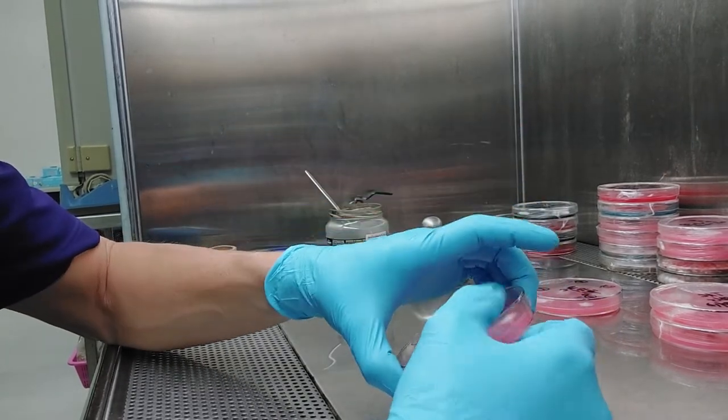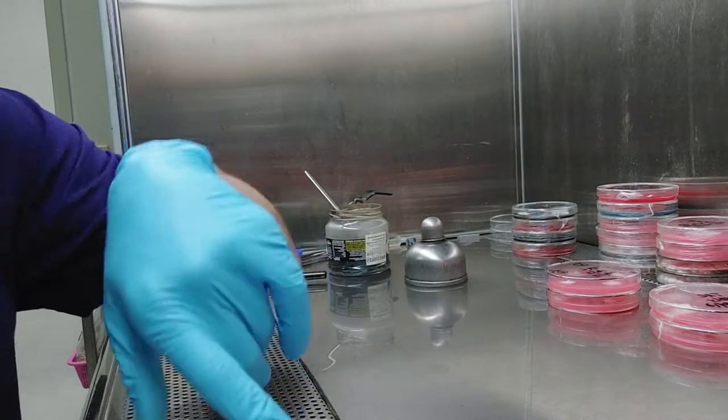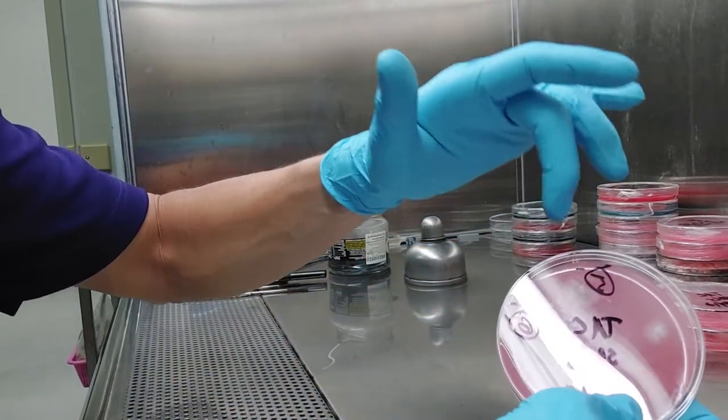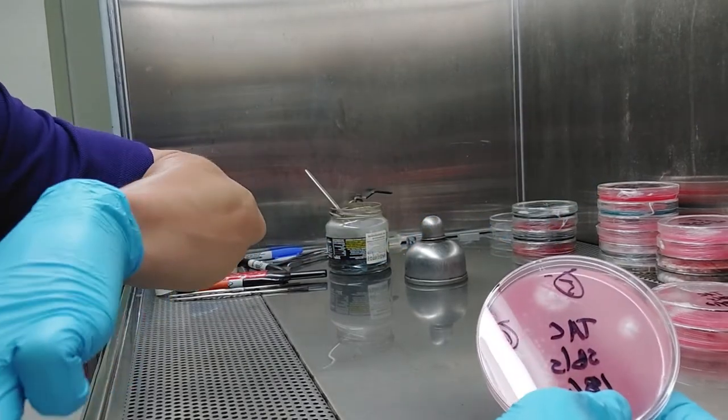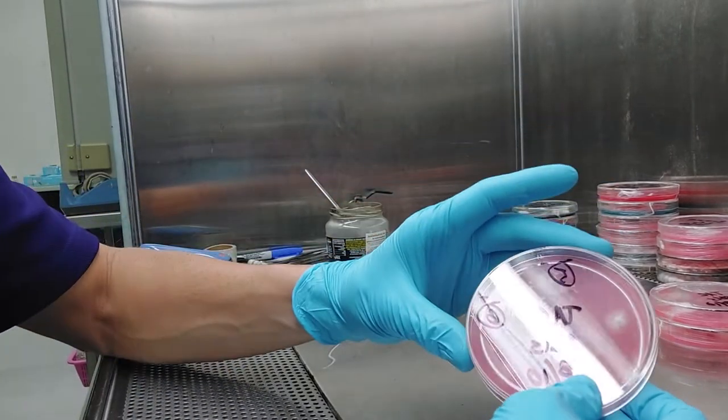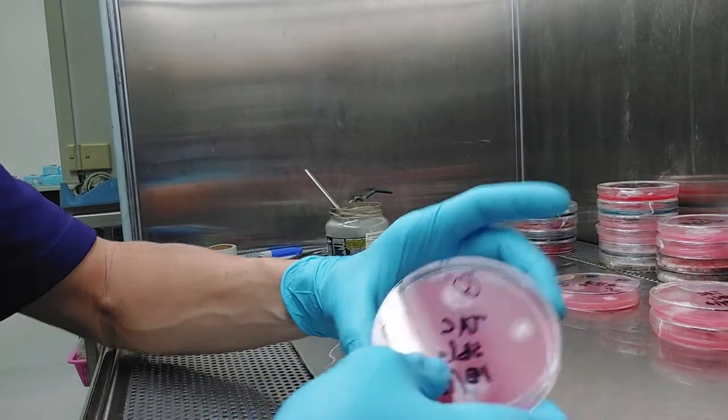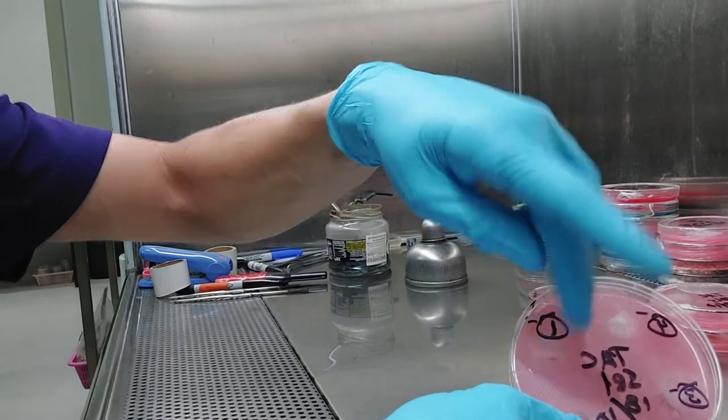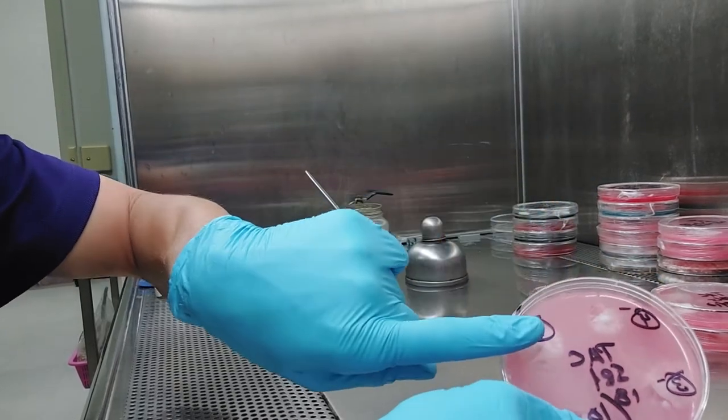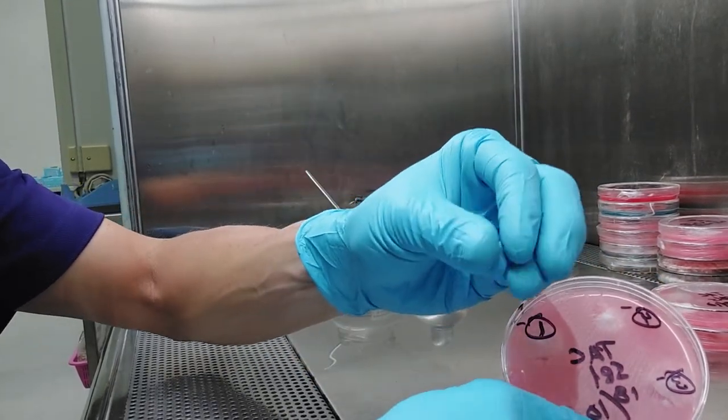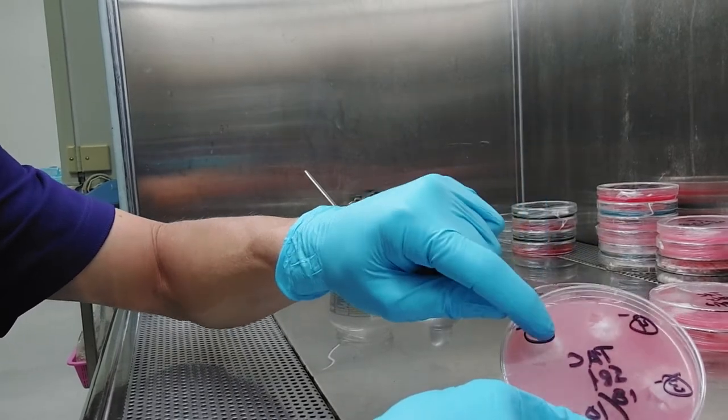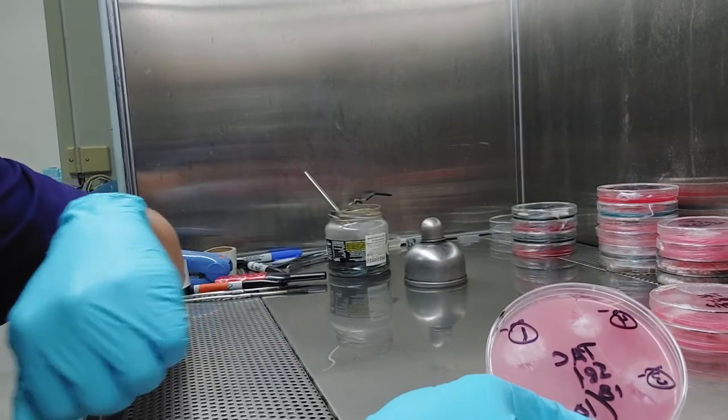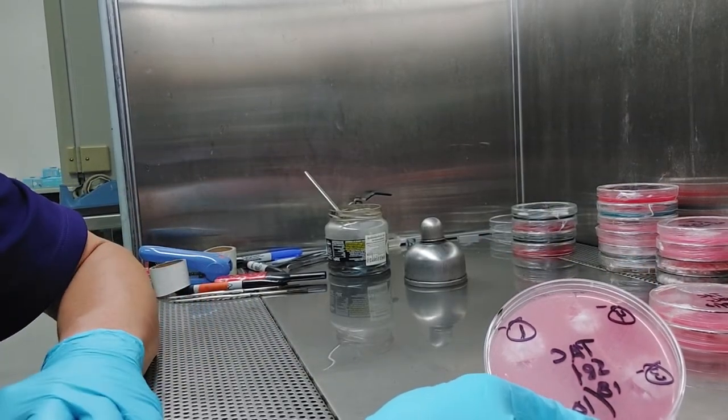And then tomorrow or maybe the next day, I can even go back to this. And if I'm pretty certain that was a single spore, I can actually use that colony for mating studies. So I can go back. That's another reason for marking number five. So if I want to go back and I take TAC M1, which is monocaryon number one, I can pull off a tiny, tiny little piece. Remember, you only need like a tenth of a rice grain size of that colony. And then you mate it on another plate with another culture.